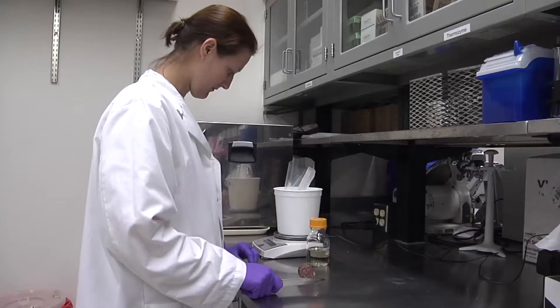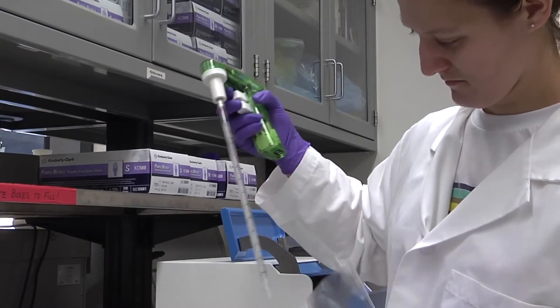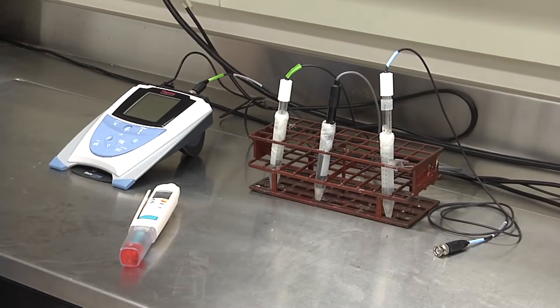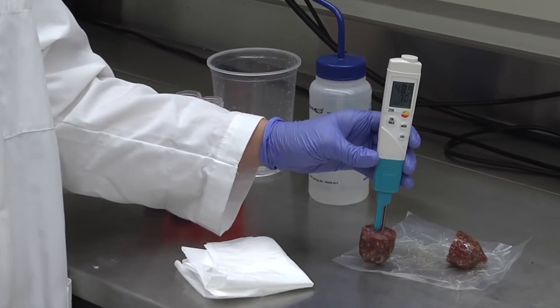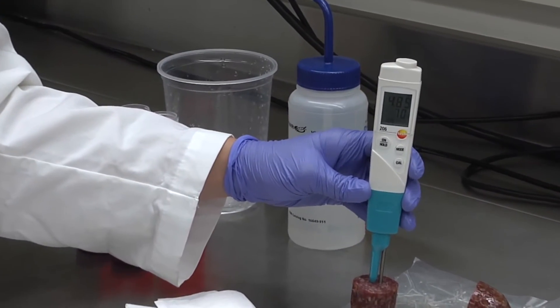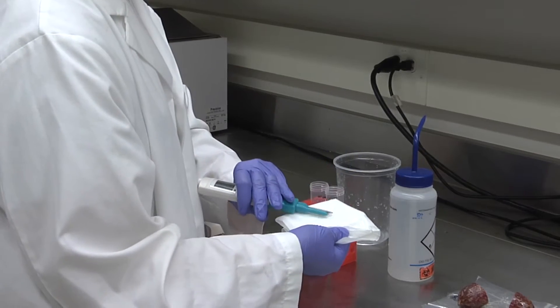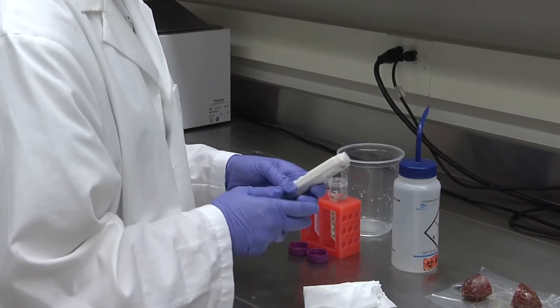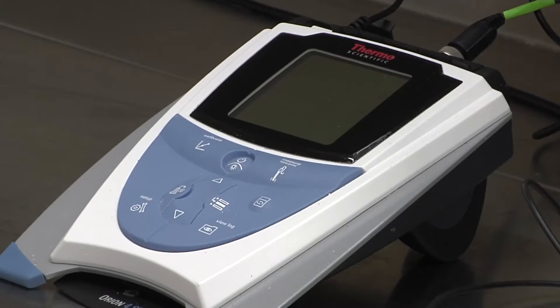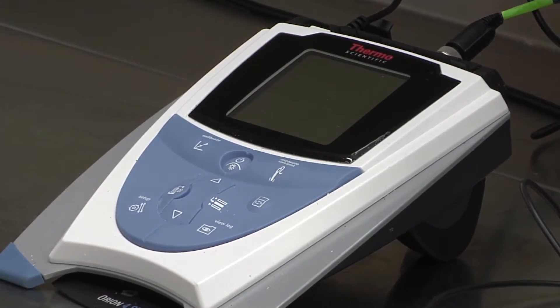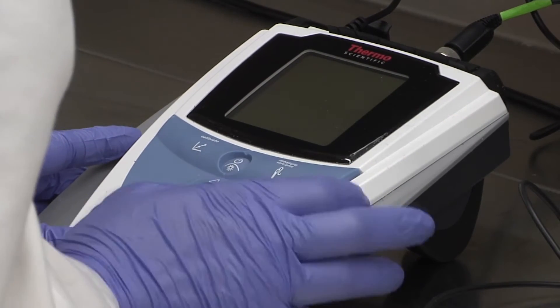In this video, we will discuss various methods of measuring pH. There are many different types of devices used to measure pH. Meat products are unique when measuring how acidic or basic a sample is. Choosing the correct electrode and meter combination is critical in gaining accurate results. Portable and benchtop pH meters will be discussed and demonstrated during this second learning objective.